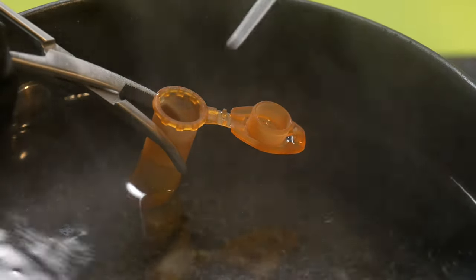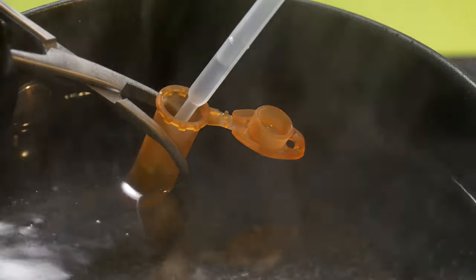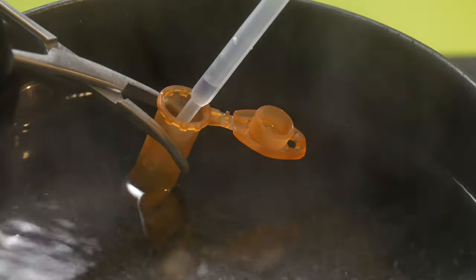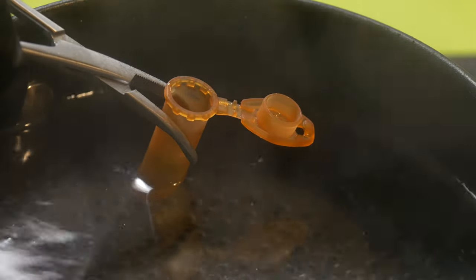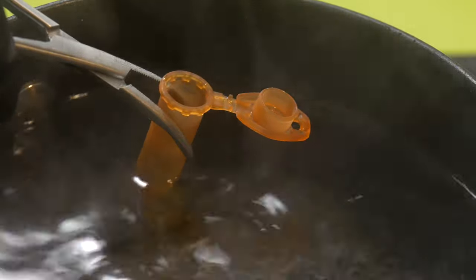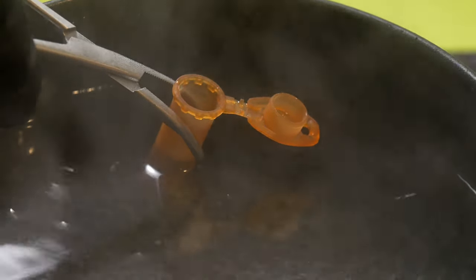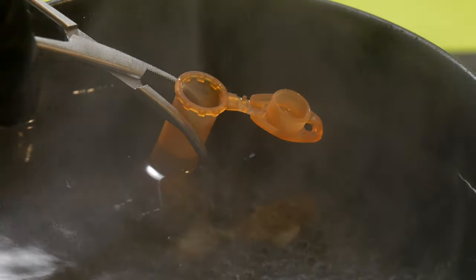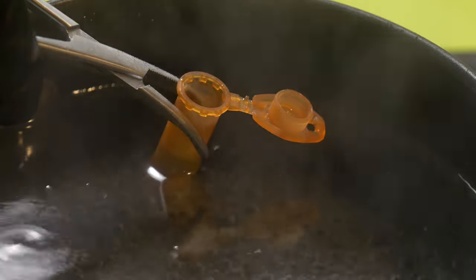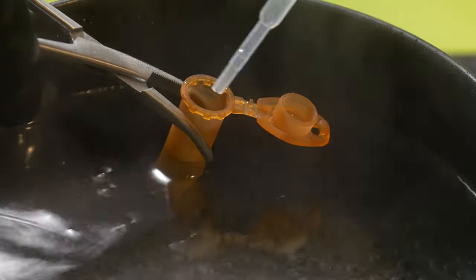I simply submerged the Eppendorf tube using some forceps into the boiling water. I took small droplets of water at 20 seconds, 40 seconds, and 60 seconds, plated around 100 microliters onto our LB plates, and added small droplets of water to microscope slides for microscopic visualization.